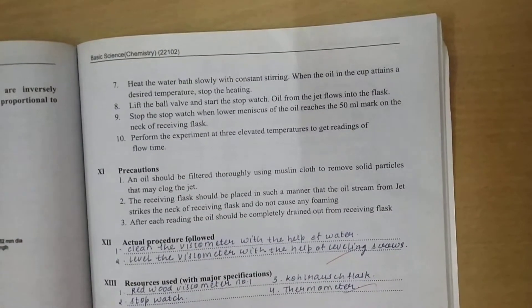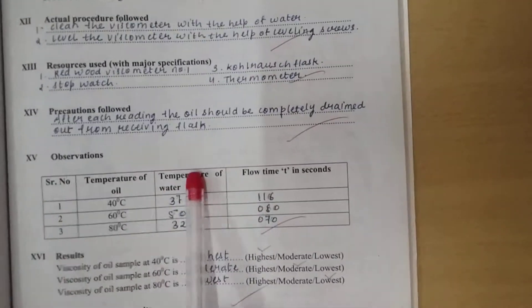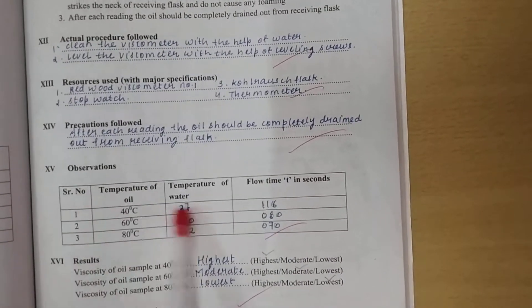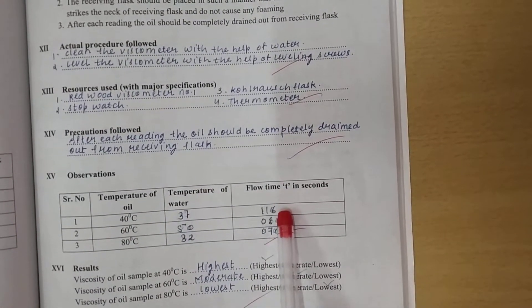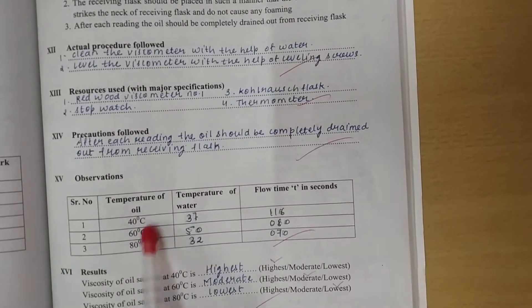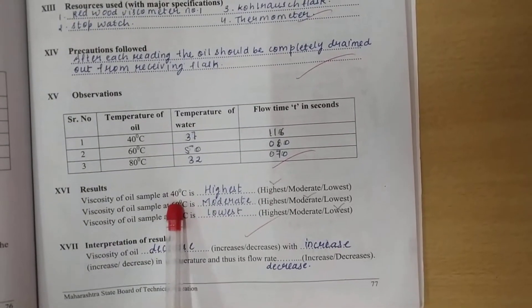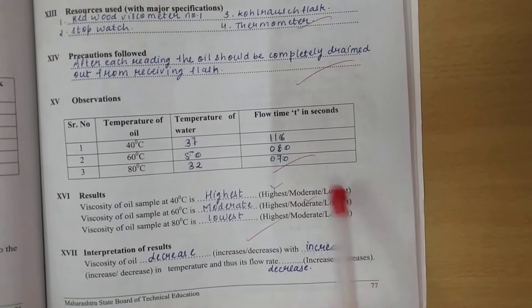Here is the observation table. At 40 degrees, what is the temperature of water and what is the temperature of oil? Oil and water are at different temperatures. The time in seconds is required for flow of oil from one end to the other end. Three readings are to be taken. Finally, the result: viscosity of the oil sample at 40 degrees centigrade is recorded as highest, moderate, or lowest.